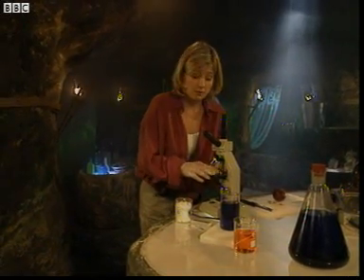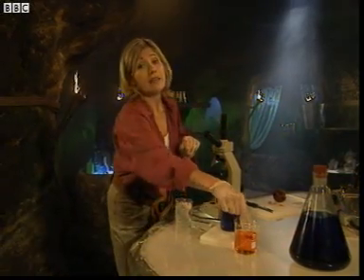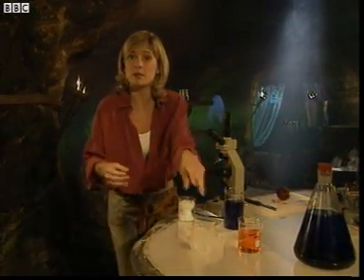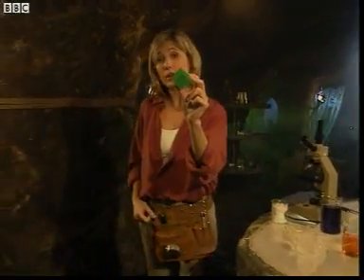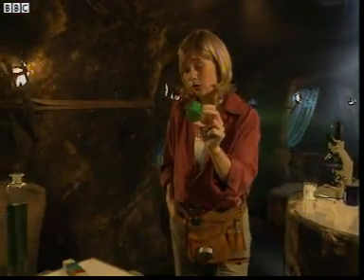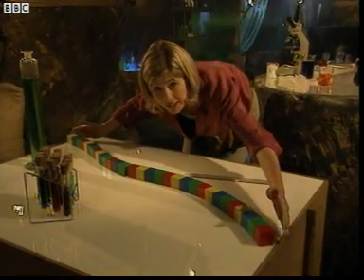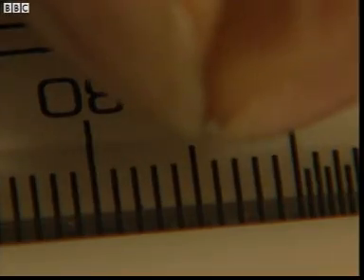And at a thousand times magnification, you can see the individual cells. Most cells are smaller than these. The average cell is one thirtieth of a millimetre, which means that if this brick is the size of one cell, then thirty of them can fit into this space.